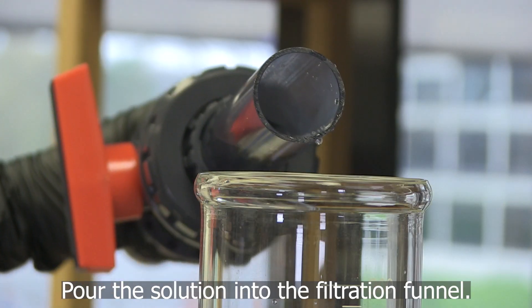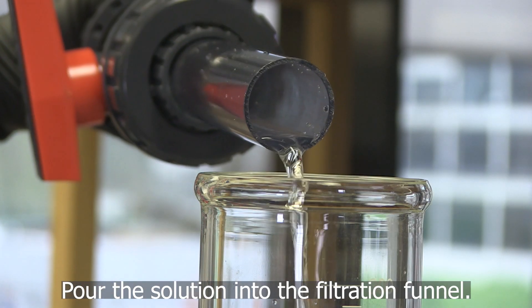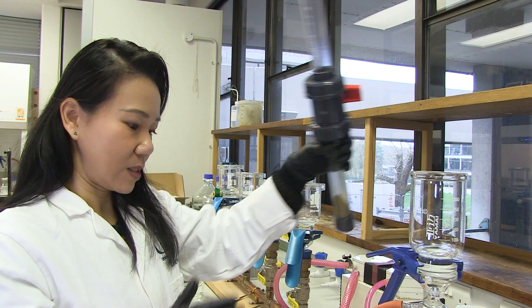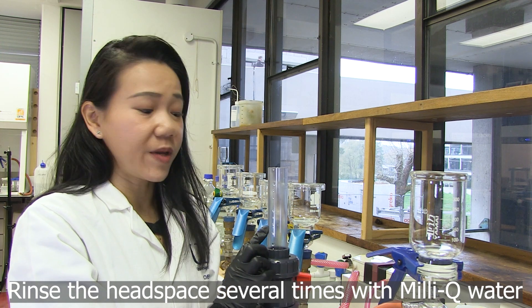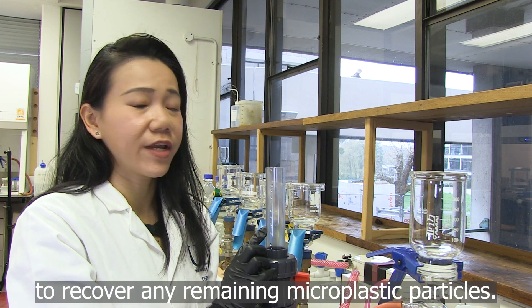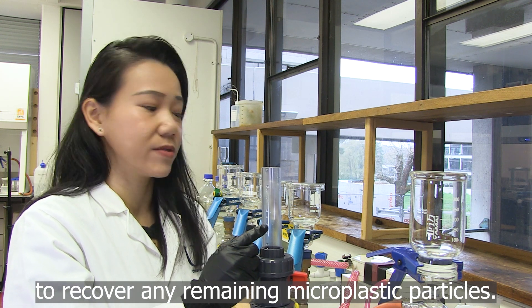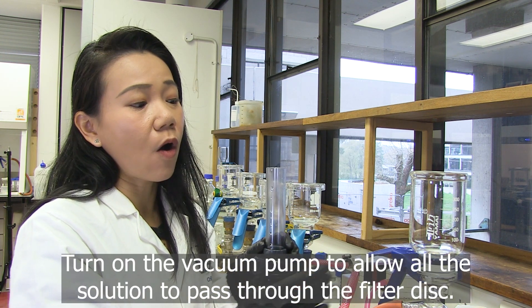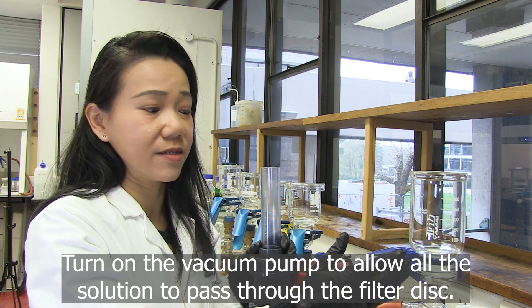Pour the solution into the filtration funnel. Rinse the headspace several times with Milli-Q water to recover any remaining microplastic particles. Turn on the vacuum pump to allow all the solution to pass through the filter disc.